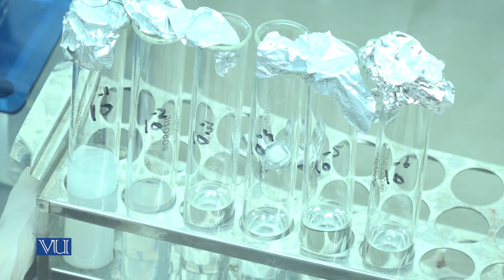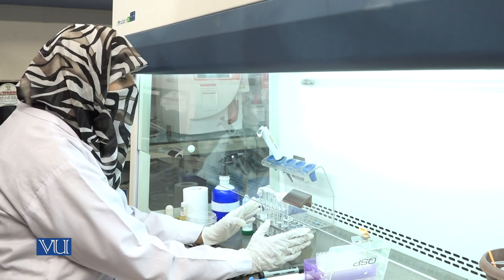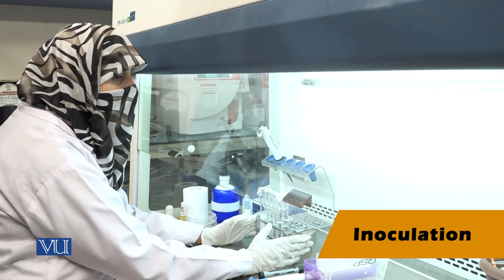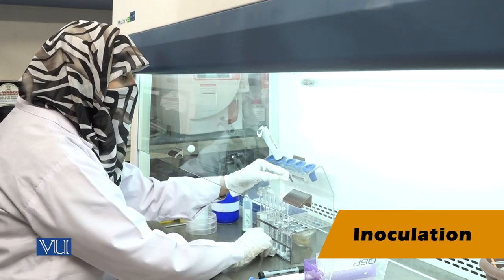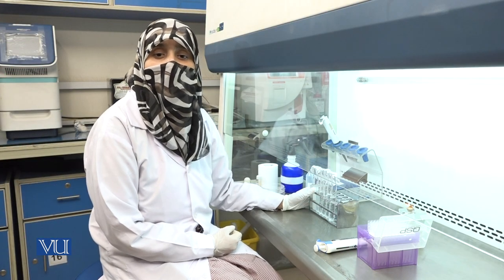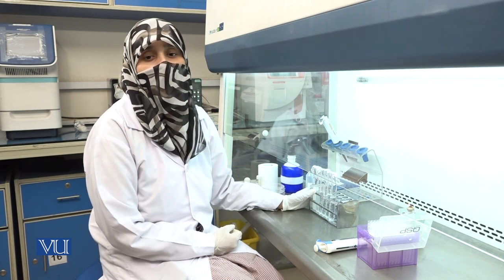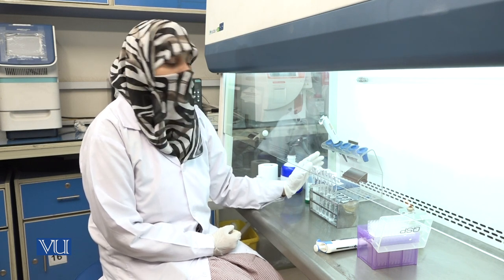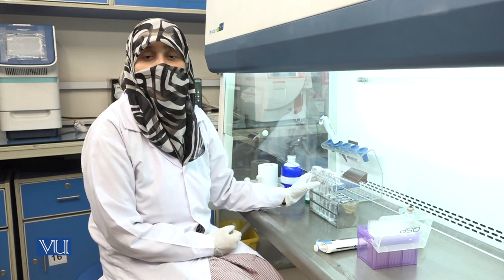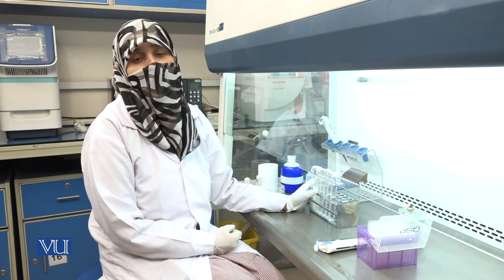This is the basic procedure of serial dilution. Next, simply inoculate the media with the desired dilution and proceed according to the manual. After completion of serial dilution preparation, these dilutions are used for inoculation on a specific media. The purpose is to take a sample from one test tube and dilute it with sterile diluent, which may be distilled water or 0.9% saline solution.